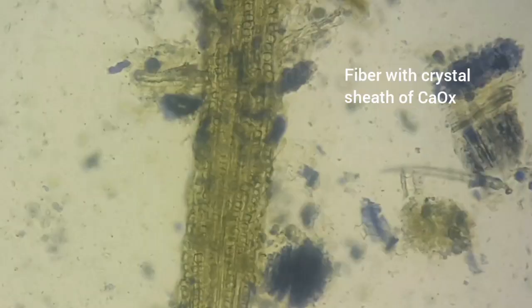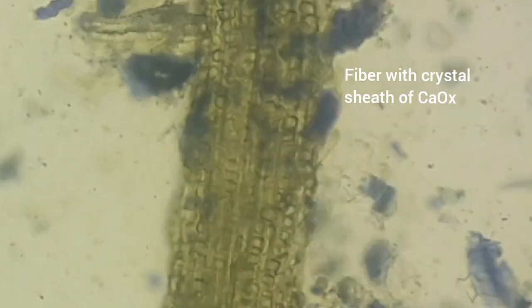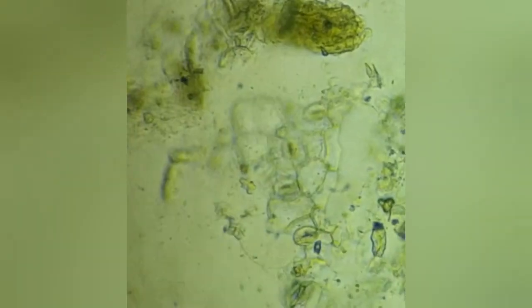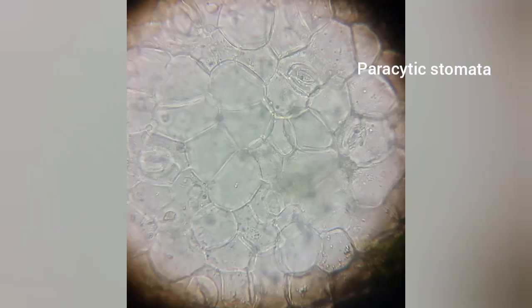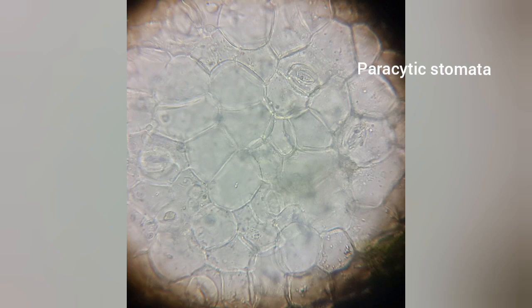In the picture, you can see crystal sheaths of calcium oxalate. The third key element is stomata. Stomata in senna leaf is paracytic, which means that the subsidiary cells are parallel to the guard cells.